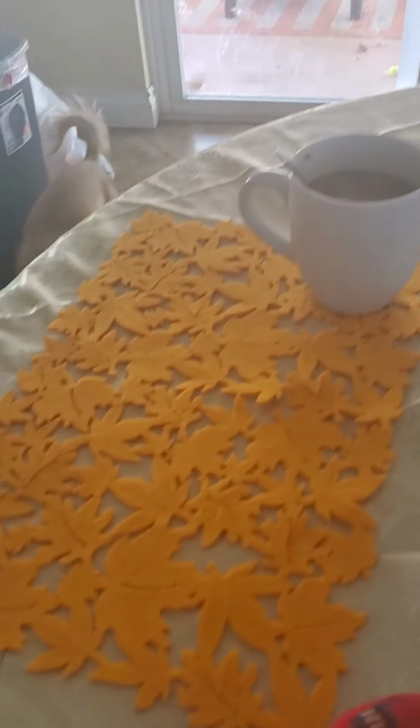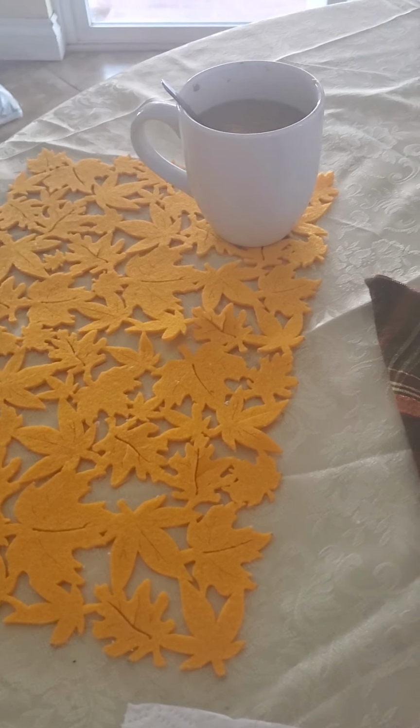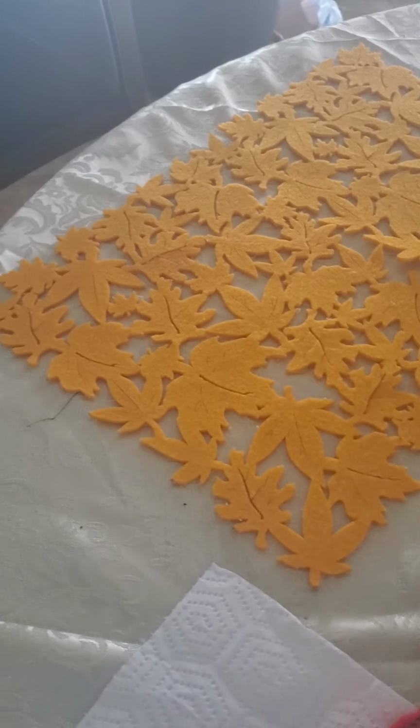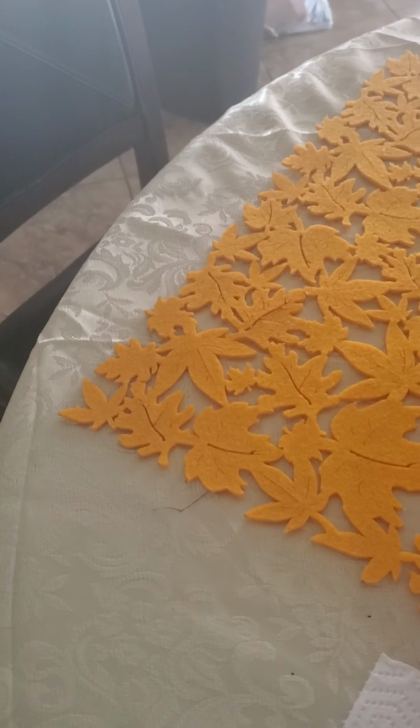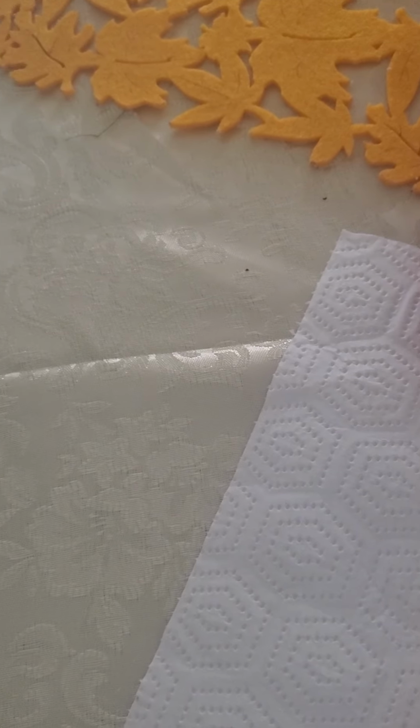This is the continuation of our experiment of aseptic technique and the growth of microbes. So I'm going to turn the camera. The first thing is I am going to take out my samples, and I kept them warm in a little blanket because it was hard for me to keep the 37 degrees that we needed, the appropriate temperature for the samples. So let's get the samples out.